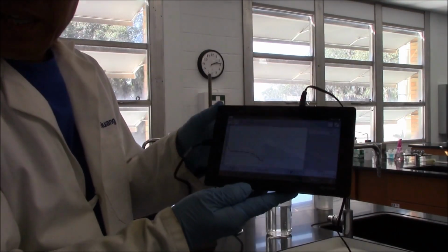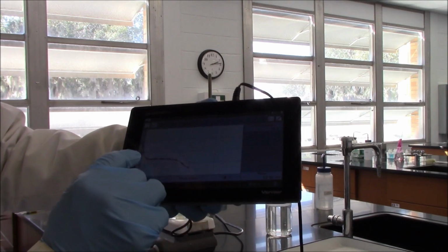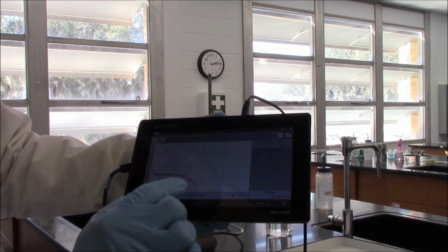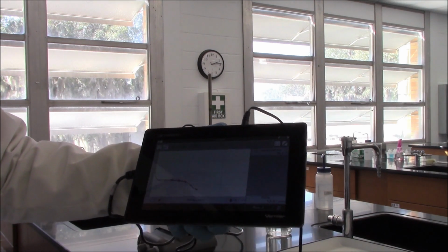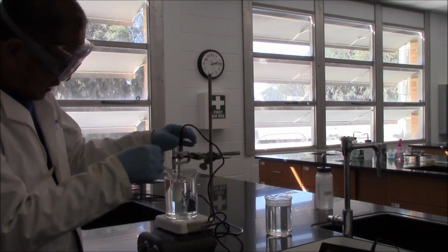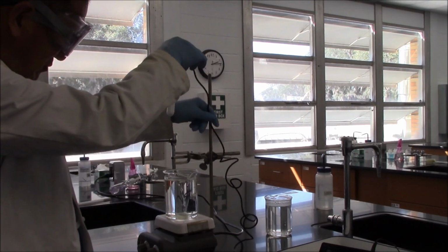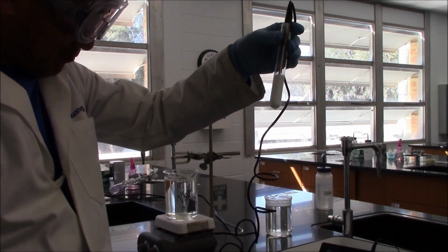Let's look at the graph first. We can clearly see that the temperature does drop after the melting point or freezing point. At this point, the experiment is done. It took us less than 15 minutes. And if you look at the test tube, it's completely solidified. So the experiment is successful.